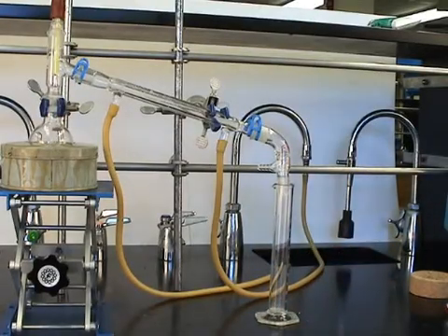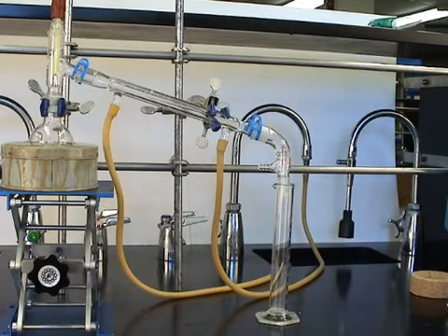Finally, we insert a receiving flask, in this case a graduated cylinder, and we're ready to go.